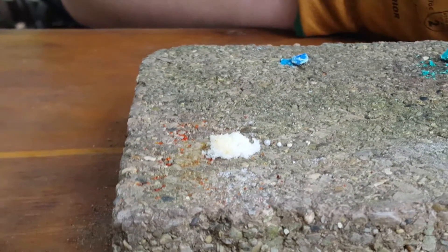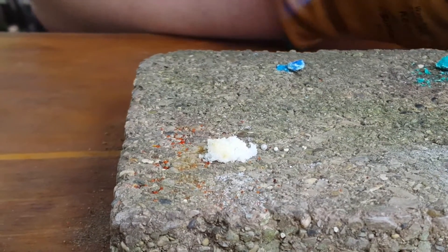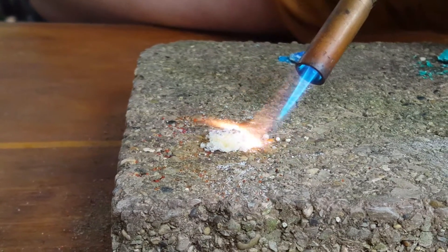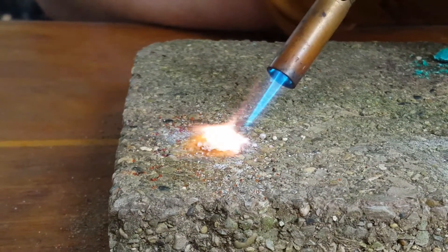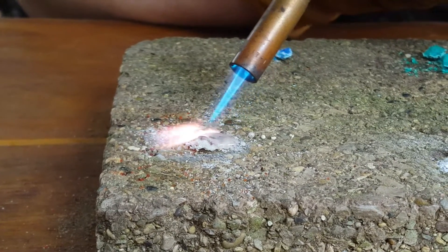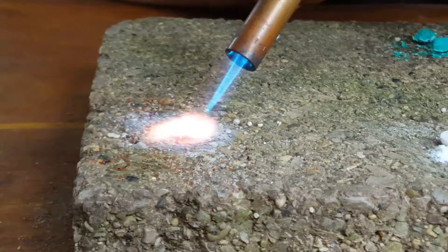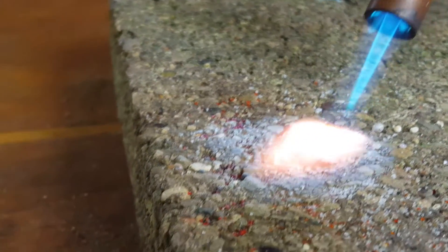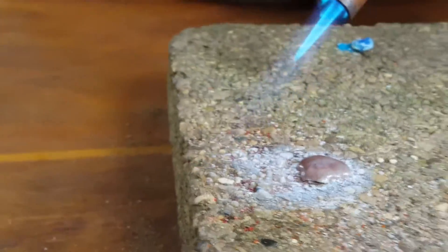This salt is potassium iodide, and there is still a little sodium left, but as you can see, the potassium burns with a light purple lilac-colored flame, and it melts easier than the other ones do.